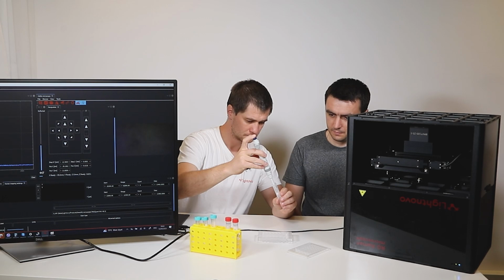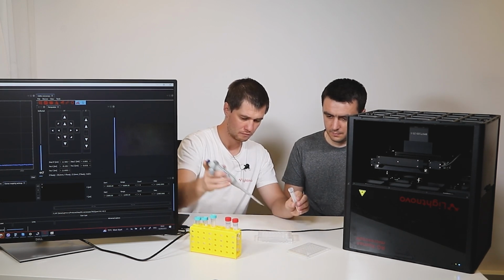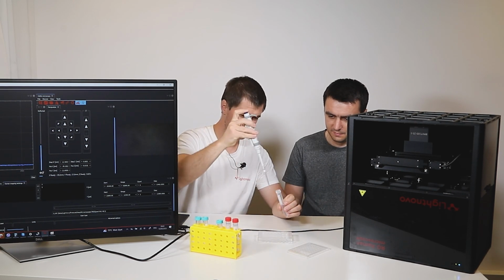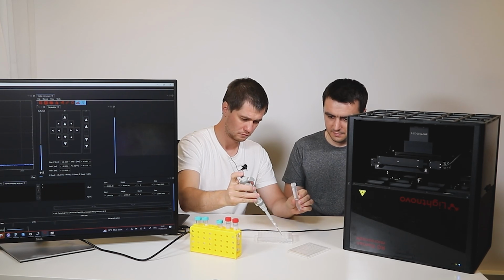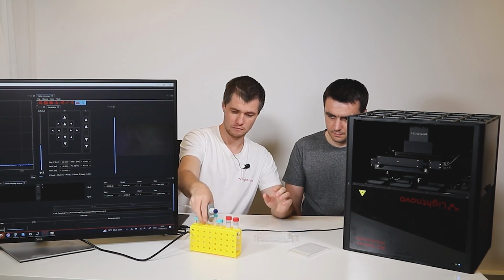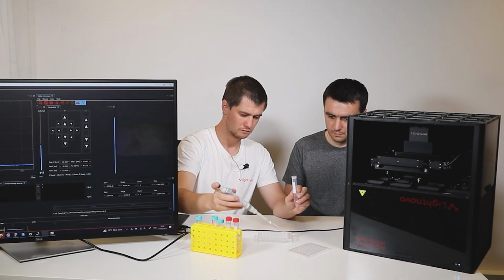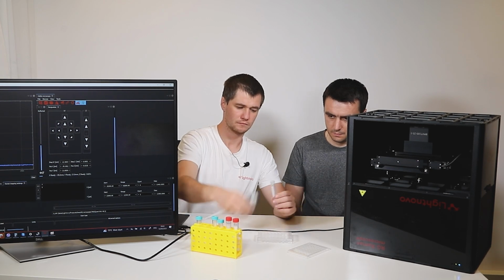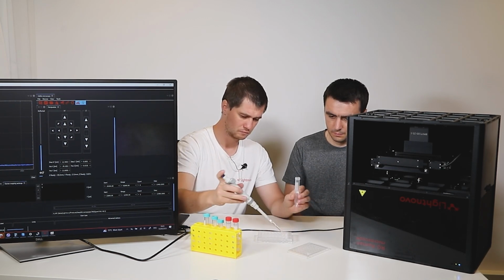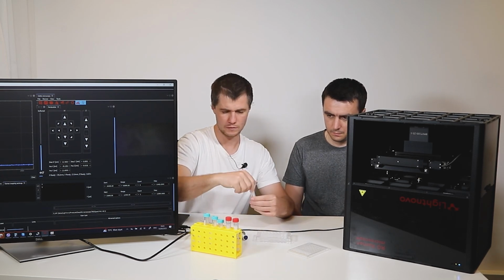Then 10%. 5%. Again 1%. And clear vodka. Good.